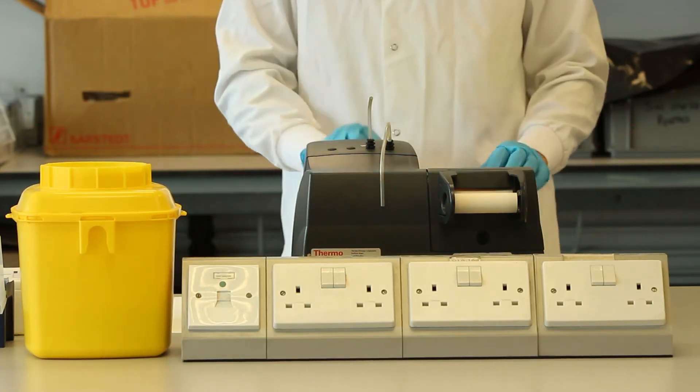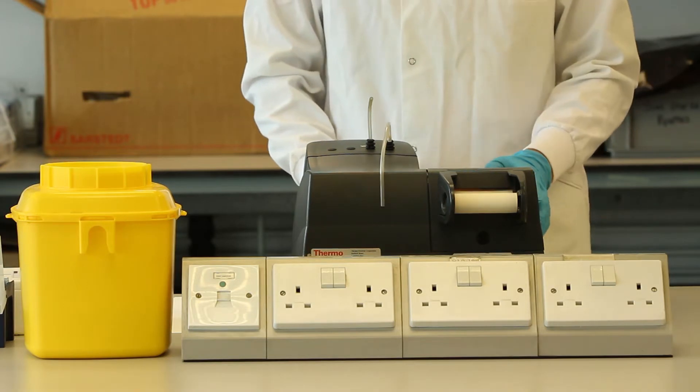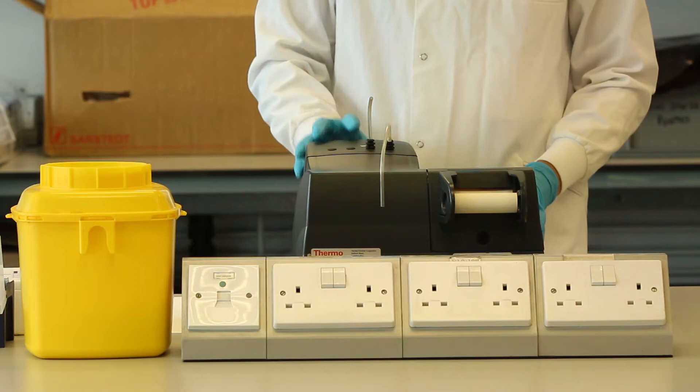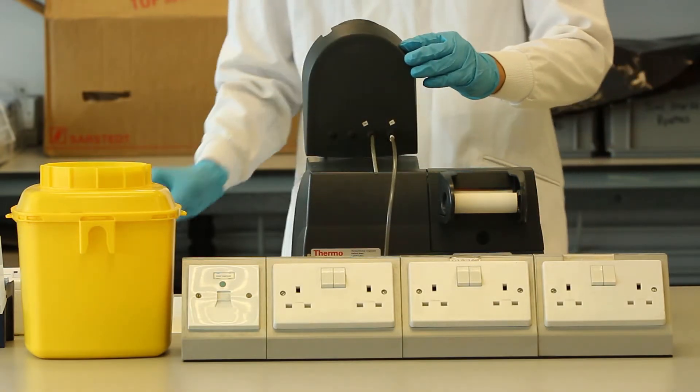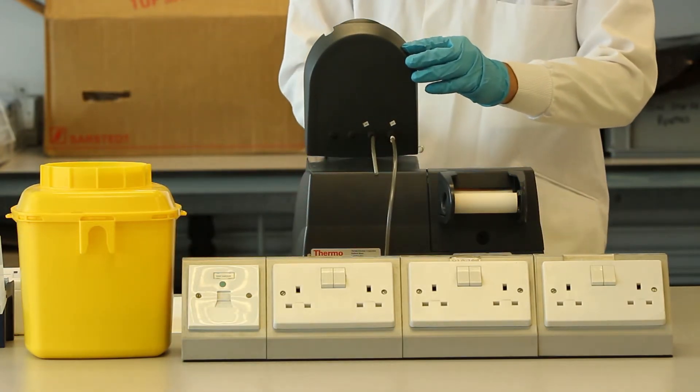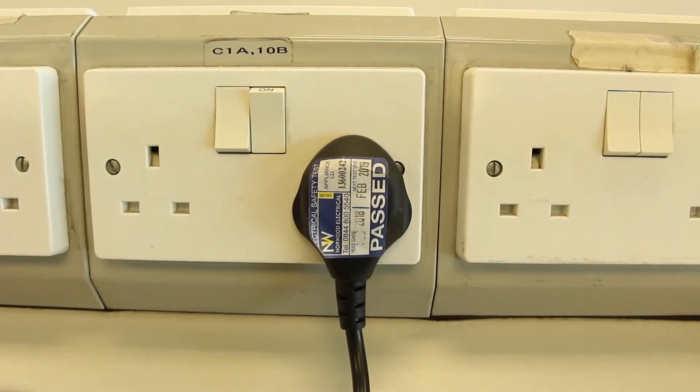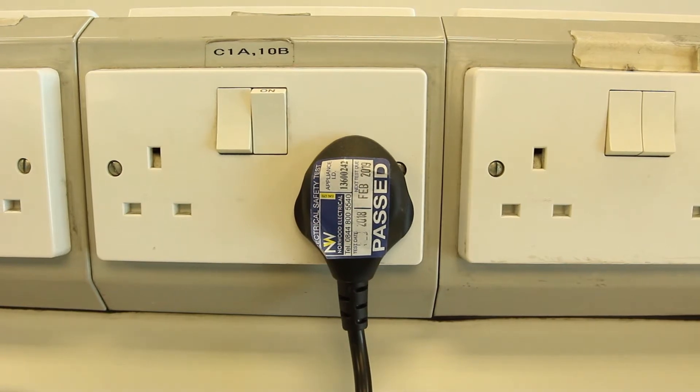So when you are ready to start setting up the spectrophotometer, although you may have chairs to hand it may be safer to remain standing so that you can move away from spillages. Make sure the spectrophotometer is plugged in and that there is power going to the instrument.